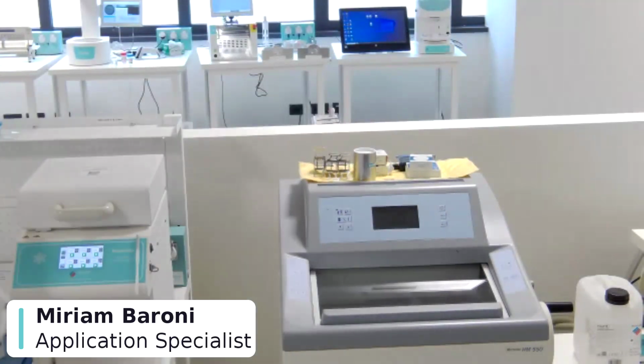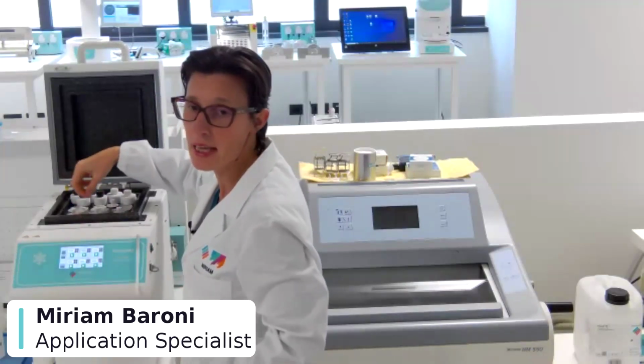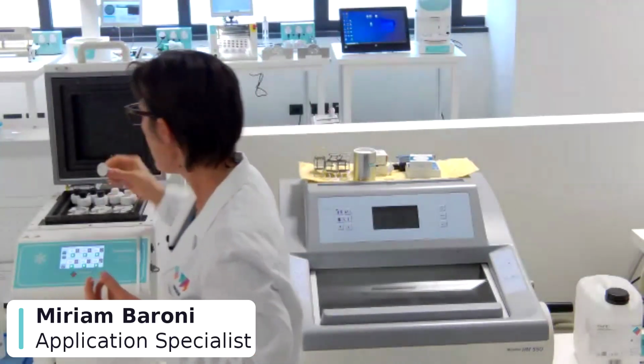One is with the use of a round disc, in which we imitate the use of a slide that sometimes is used in this technique. And with the cryospray, we can fix all the margin of the sample to the glass and then transfer the glass inside the mold. Then we add the medium and we create the block. At the end of the freezing, we need to heat up the glass a little bit in order to remove it from the block. But in this way, we have a perfect flat block that is level with the chuck.